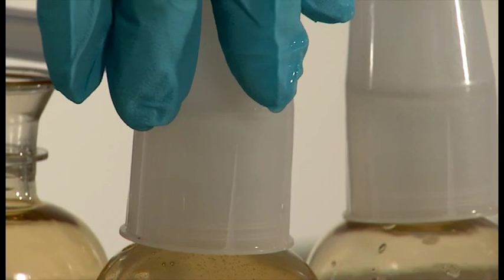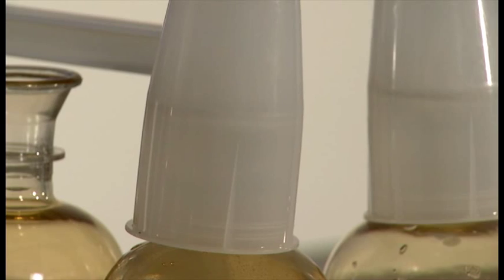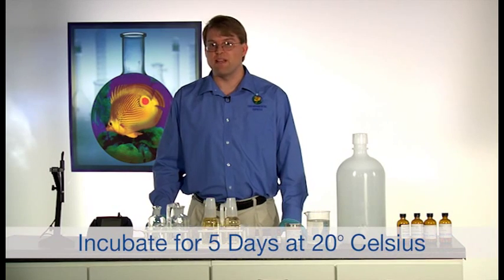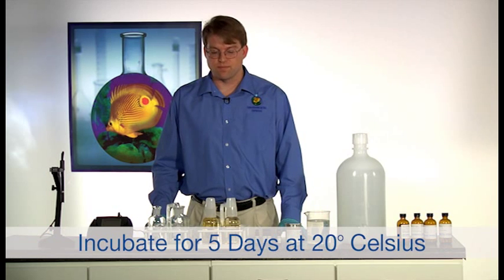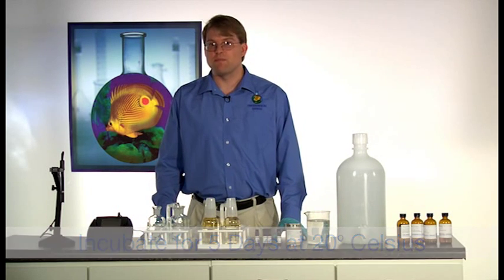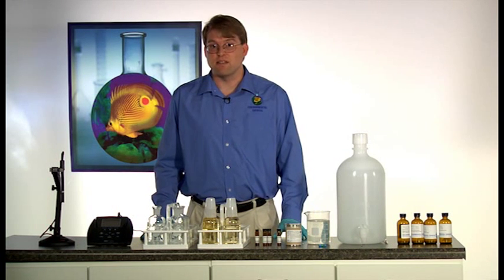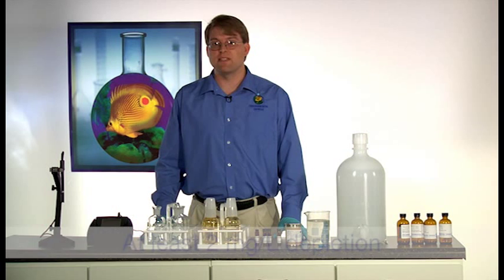Place the overcap onto the bottle and it is now ready for incubation. For example, samples should be incubated for five days at 20 degrees Celsius. After the five day incubation period, remove your samples from the incubator and determine the final dissolved oxygen content.